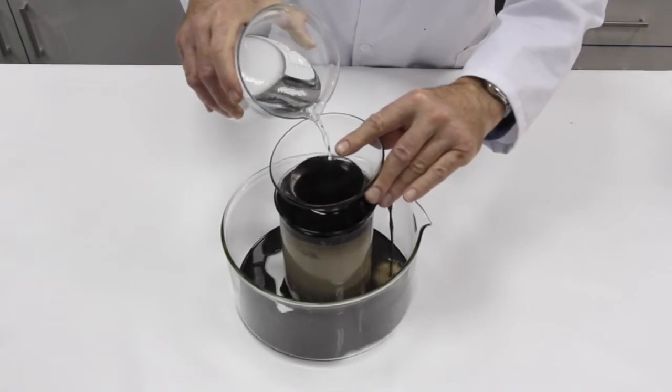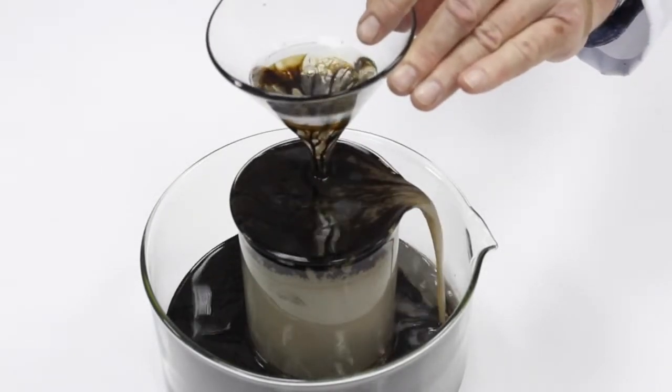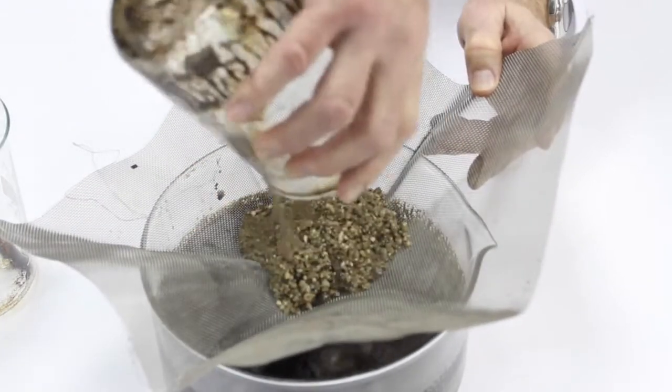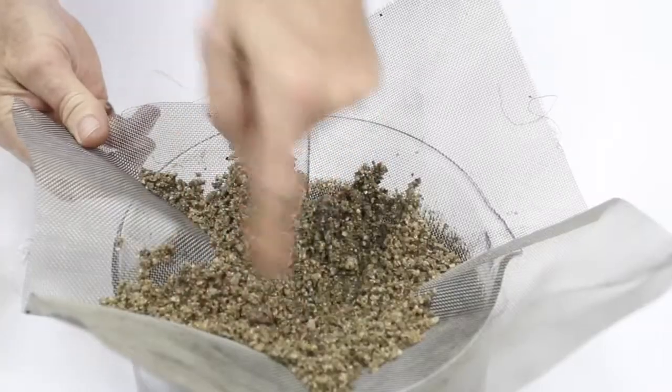The lab technician pours water, and the liquid that overflows is decanted in another beaker, making sure that the crude oil residue doesn't impregnate the sand. The sand is placed in a mesh with a pore size that permits holding it. We can see that all of the crude oil that impregnated the sand has detached, and once again the sand is clean, just as it was before the demonstration started.